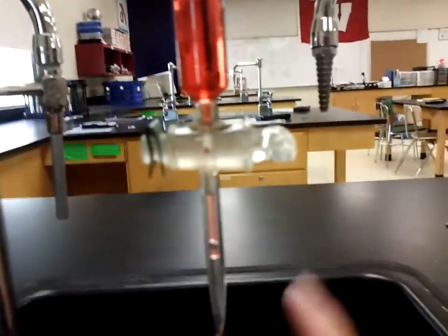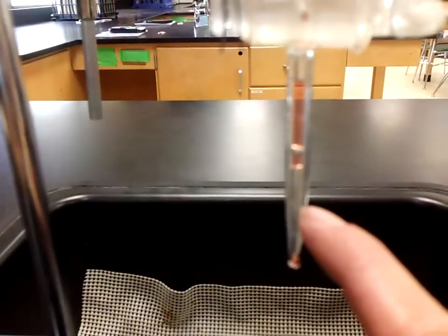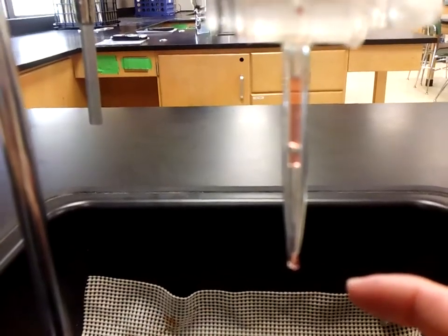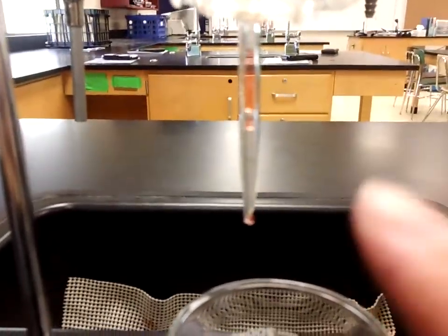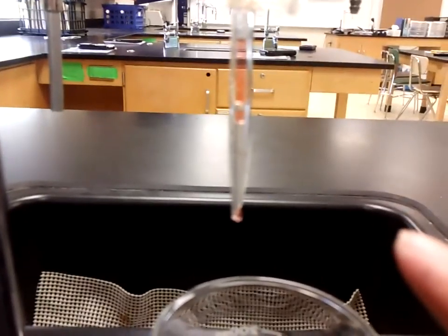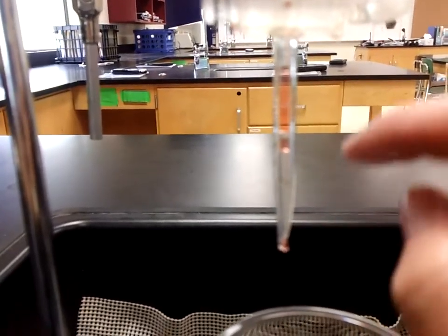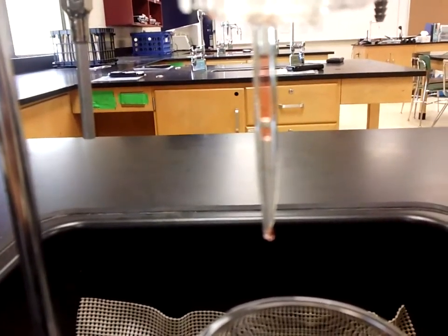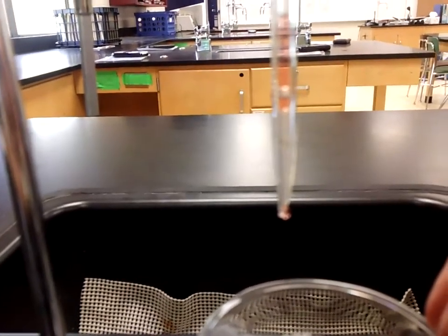Please note, when we let this out, we're going to be determining how much volume we figure out by the starting volume minus our ending volume. However, if you don't start with any of the volume in the tip, if this isn't full, as soon as you release volume out of your burette, you are not actually releasing volume into your Erlenmeyer flask at the bottom. When you let liquid out, what you're actually doing first is putting liquid into the volume of this, and so you are adding it. If you didn't make sure that your burette tip was full, you would be adding it in your calculations as if you had already added that liquid into the flask at the bottom into your titration, which you haven't.